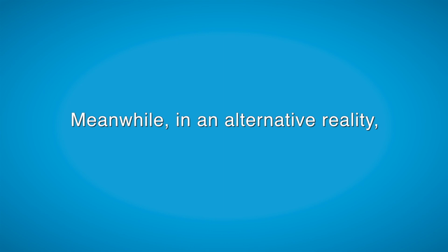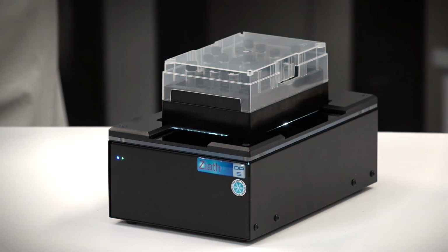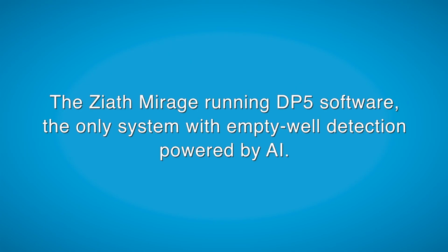Meanwhile, in an alternative reality, they'd have a Ziath Mirage running DP5 software, the only system with empty well detection powered by AI.